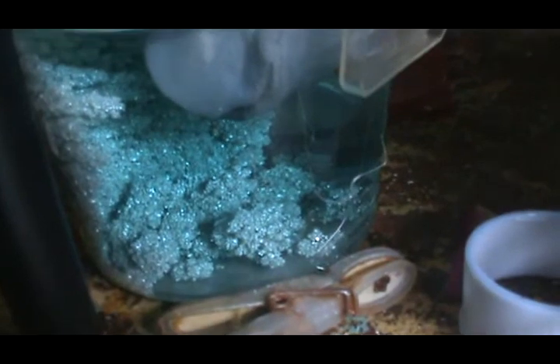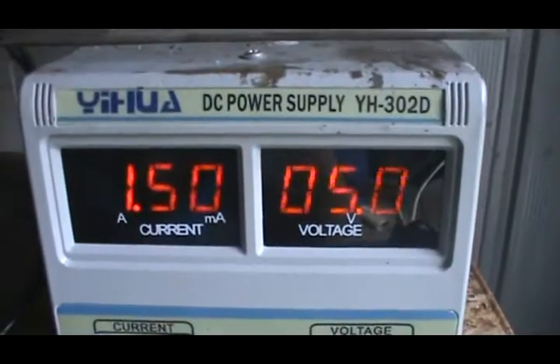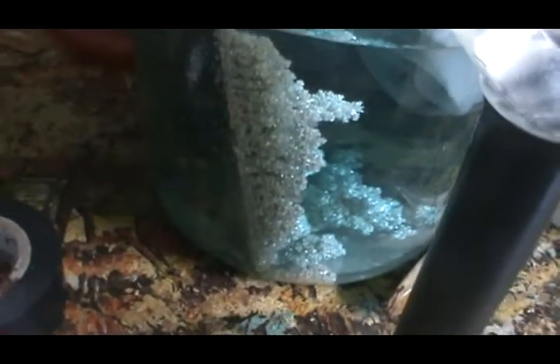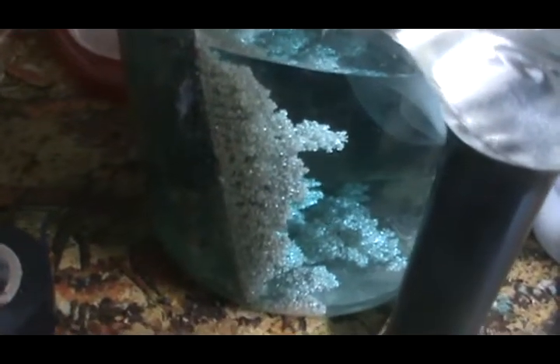If you look at them in real life, not on camera, they're sparkling — like a diamond glistening. They're so cool looking. I'm going to have to harvest this batch of crystals soon because they're going to start touching the basket. When I harvest them I'll show you the end product. They're at least 999 pure — I can tell just by looking at them. I've been doing this for quite a while and I just get a feel for how they look, and they look pretty damn pure to me.